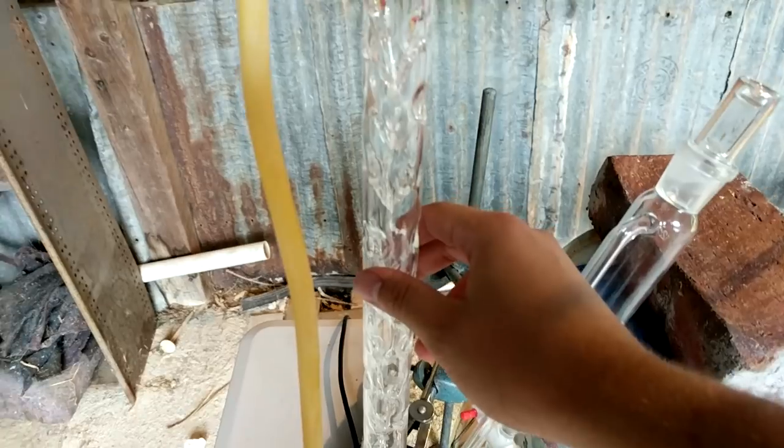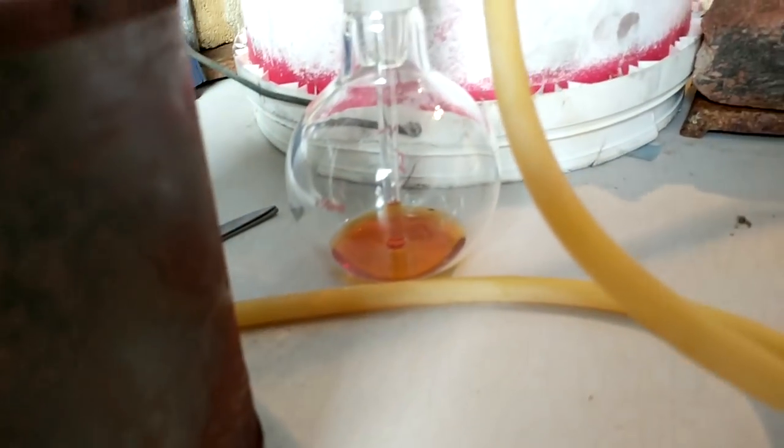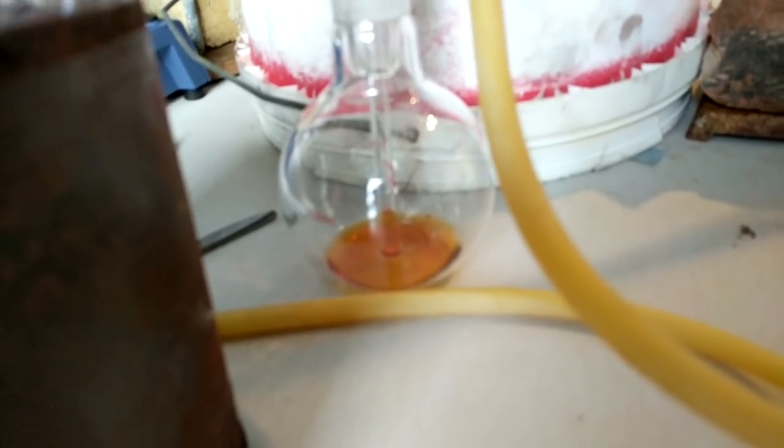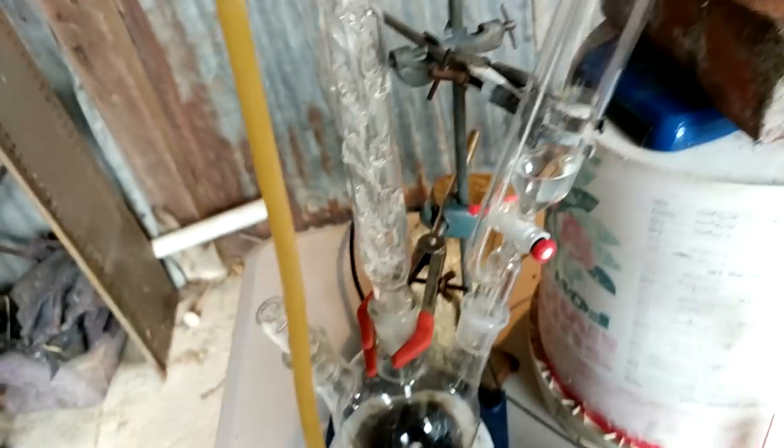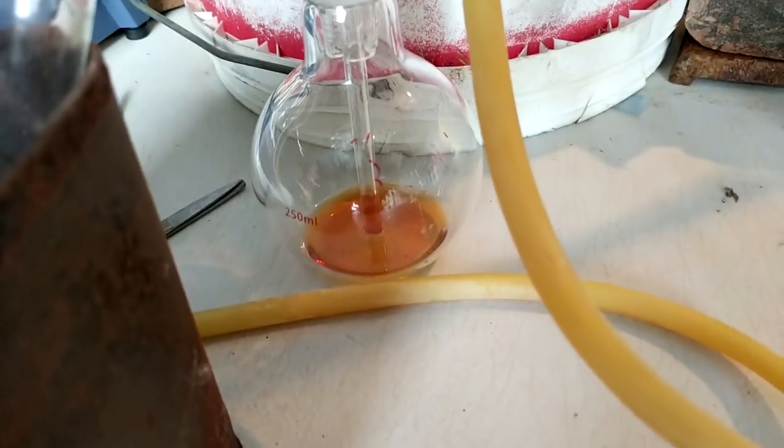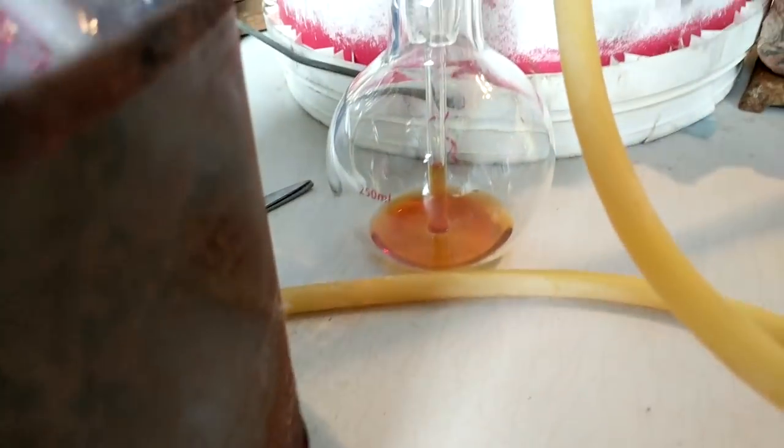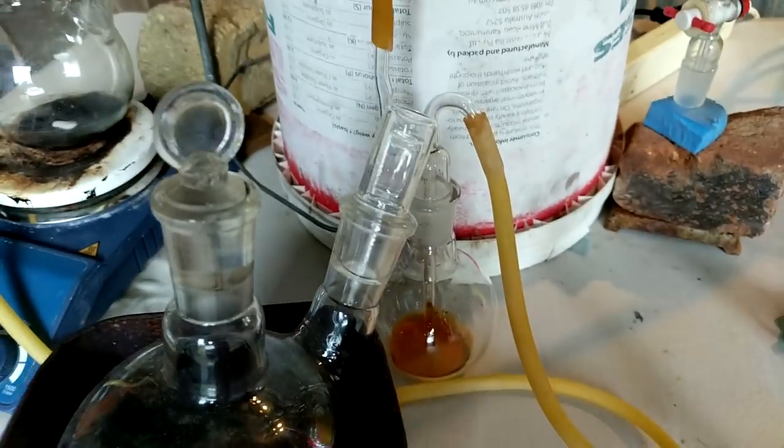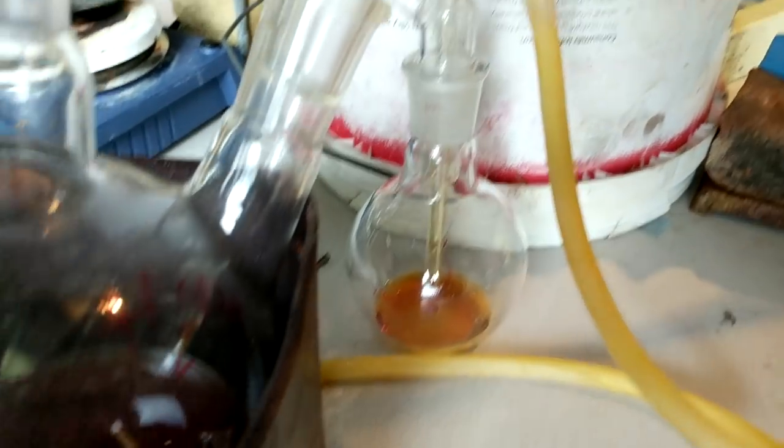So this apparatus is now slowly filling up with isobutene. It comes through here. This is once again acting as the air condenser, less than ideal, but once again, I only have one pump. So isobutene comes out, goes through this hose, goes through here. This is some sulfuric acid, which is looking like it's getting sucked back. I don't really need it to dry the isobutene, but really it's acting there as kind of a flow rate monitor because otherwise I have no way of knowing if anything is actually coming through.